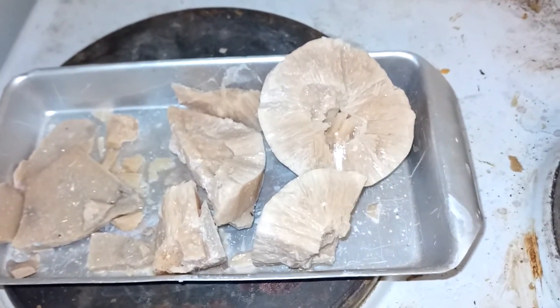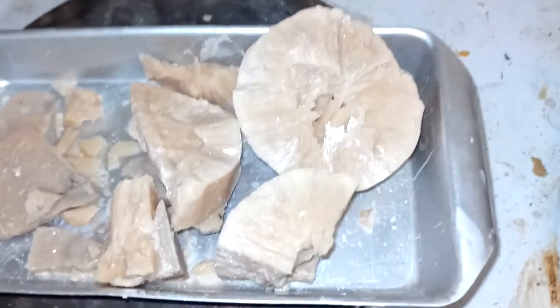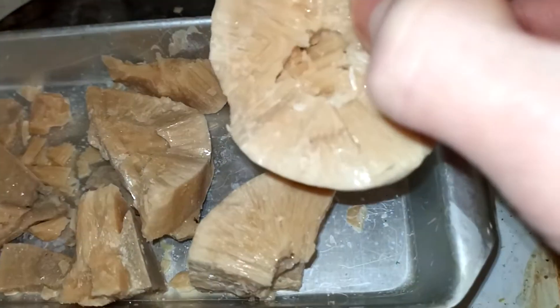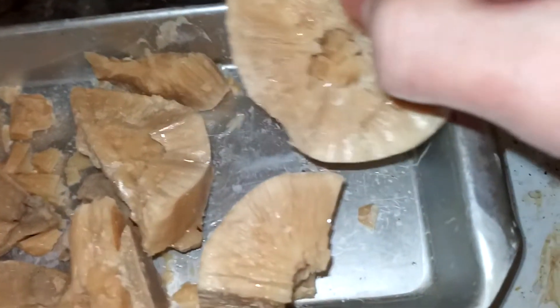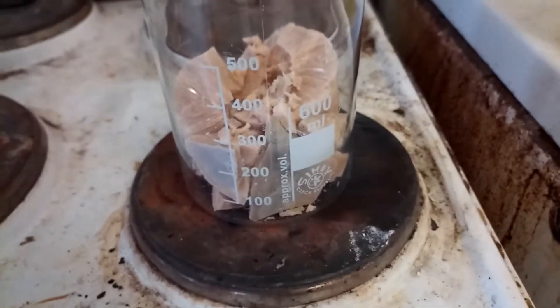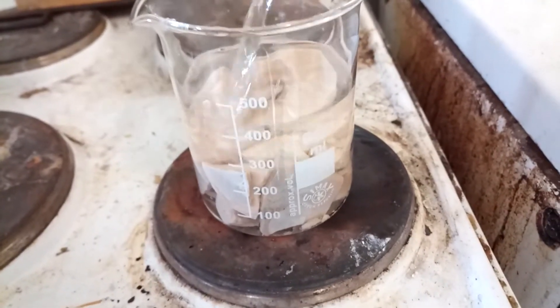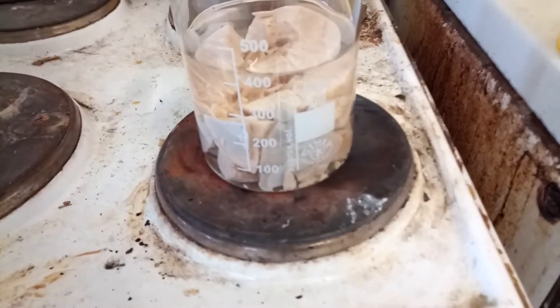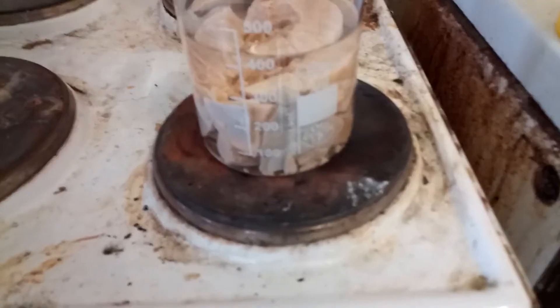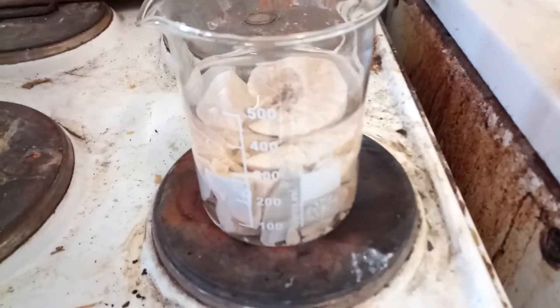I had to break that large chunk of material up a little so it would fit in this beaker. It crystallized and made these weird geode-like crystal formations, which is quite interesting. The next thing to do is to dissolve this in a bunch of water, because this is a mix of the urea I started with and the biuret I want to make. It also contains some other things like cyanuric acid, another decomposition product of urea, and possibly melamine or other condensation products.